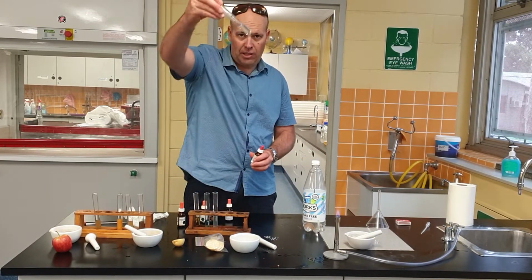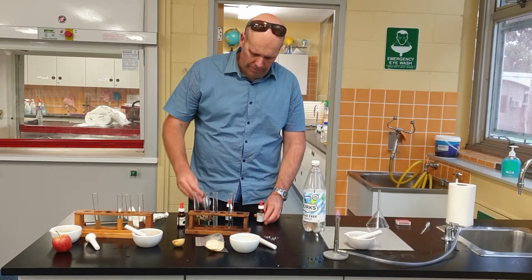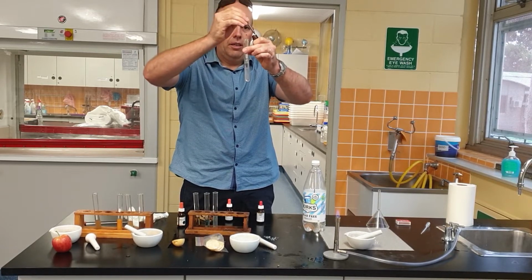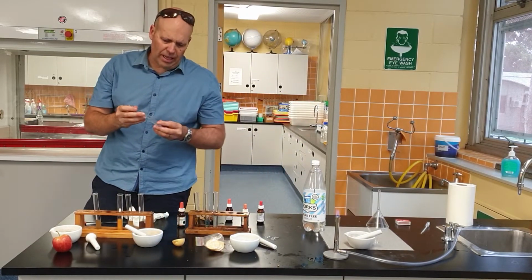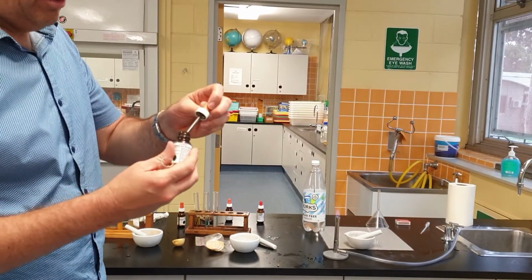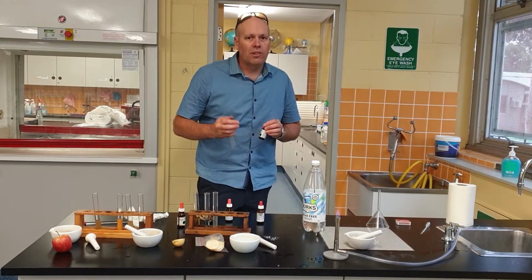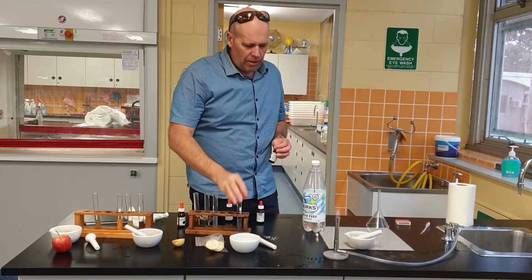And then the last one we've got is our salts. Last one. Oops, I put the wrong thing in. Silver nitrate. Let's try it. Aha. What do we got here? Has it got salts? Is it similar to the colour of the silver nitrate? It hasn't gone really cloudy white, has it? Oh, there might be a little bit in there. Has it got sodium? It does have sodium in it, so I would say, yeah, absolutely. There is a little bit of salt in there. You can see it's gone a little bit cloudy. So, yes, I would think so.